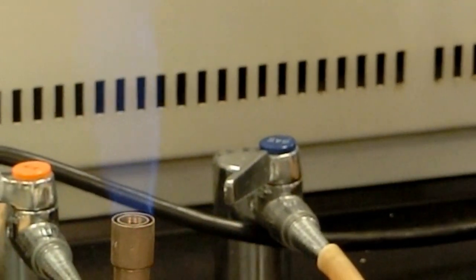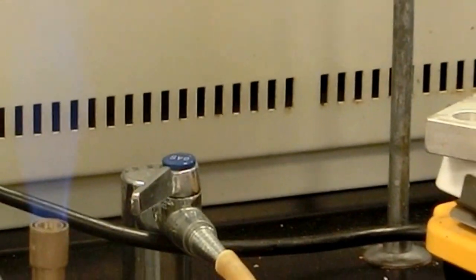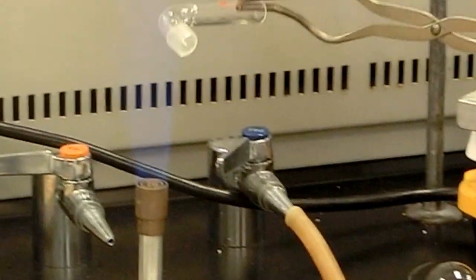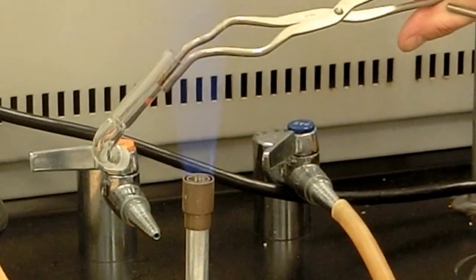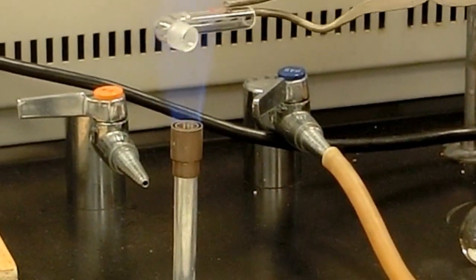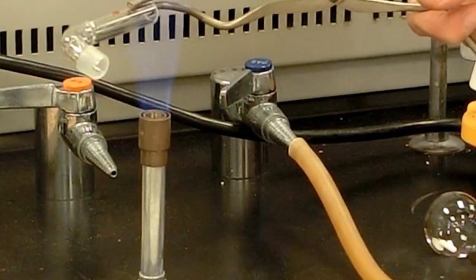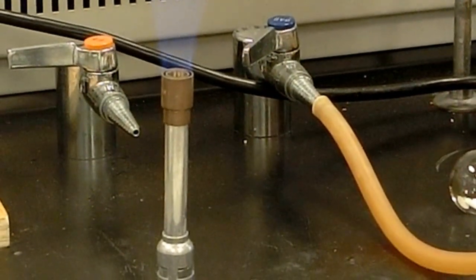So this round bottom now is considered to be fairly dry, and I'll set that down. Beware it'll be hot for a while. Drying tube. And again, I just think I'm painting this with a blue flame. Ideally, you want a nice blue flame that's a lot hotter than yellow flame. It's sort of near the tip, there's a real nice hot spot for that. That's probably good.